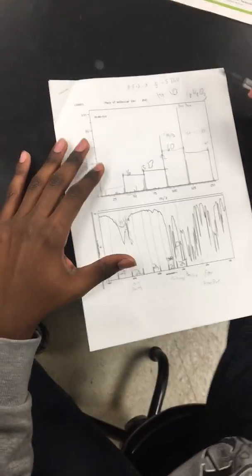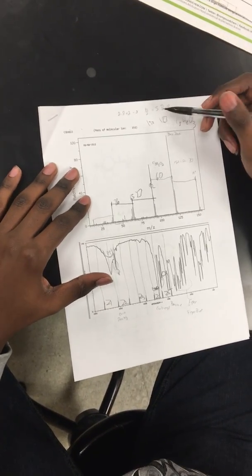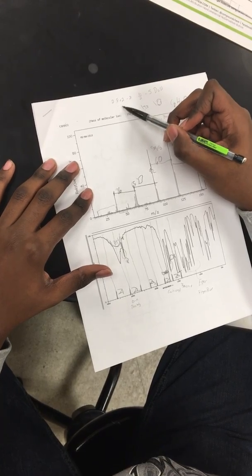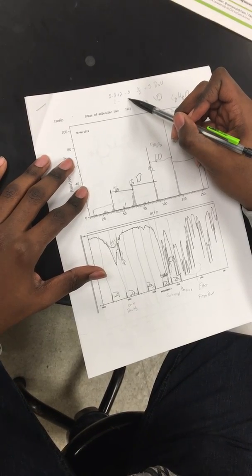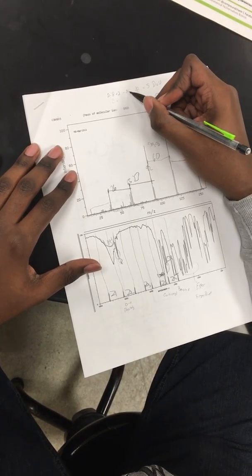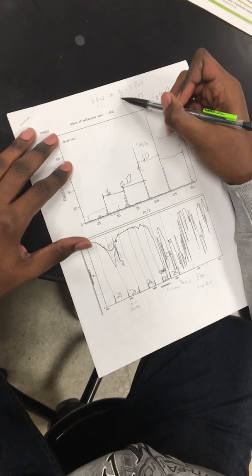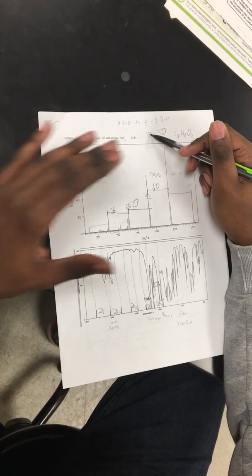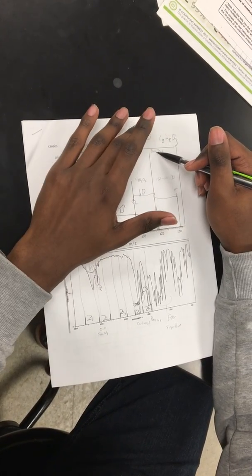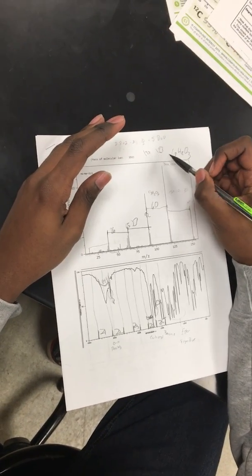To begin, let's start with the mass spec. First, we know our formula is C8H8O3, so you can figure out the degrees of unsaturation. Just do 2 times 8 plus 2, where 2 times 8 represents the 8 carbons, minus 8 to represent the 8 hydrogens, which equals 10, and we divide that by 2, which equals 5. So from that we know we possibly have one benzene ring, which would account for the 4 portion of the DOU. 4 plus 1 equals 5.